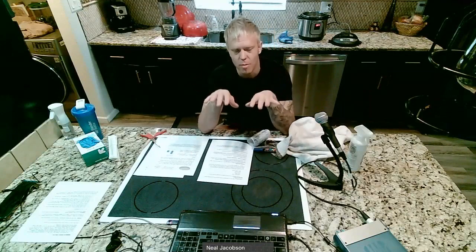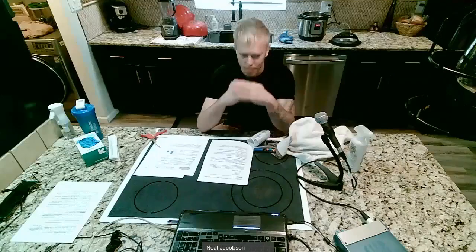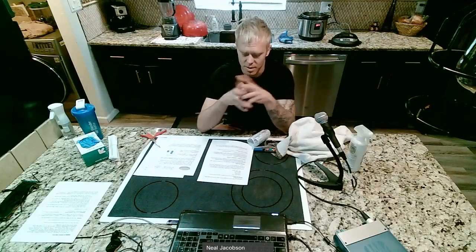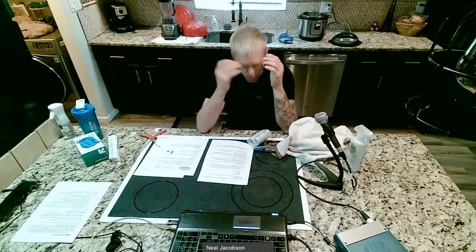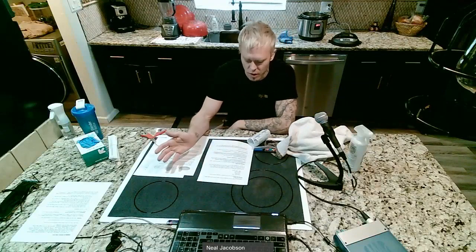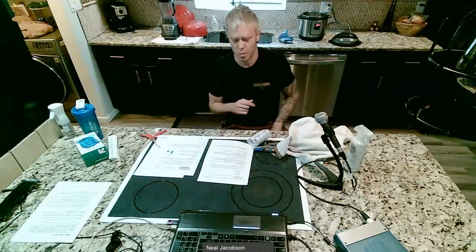Now you can ask the question why. So you see the phenomena as all these hand washing signs everywhere. You can ask the question and say, why are these hand washing signs there? And then you could pose a hypothesis, which is that there's some mechanism that hand washing has an effect on. And maybe that's why. And so we can test that. We can say, okay, what's the mechanism? What's our hypothesis? Does or does not hand washing have an effect on the number and diversity of bacteria on the hands? I'll let you guys circle that one.